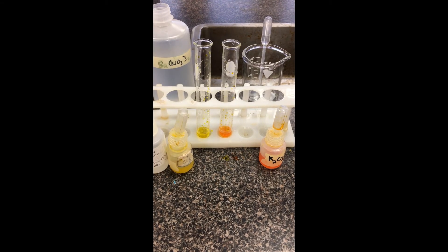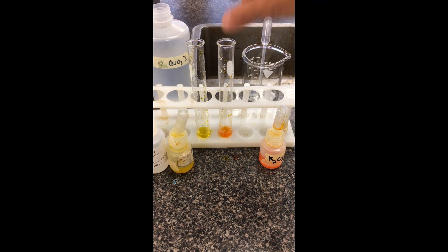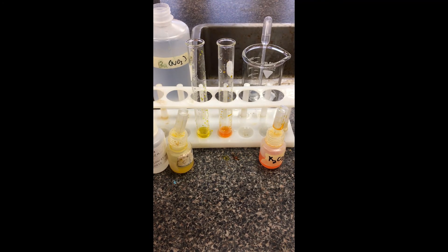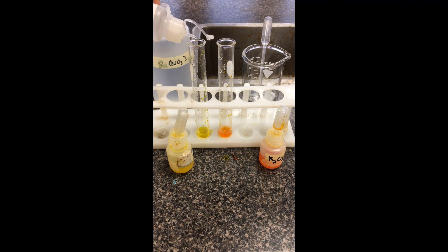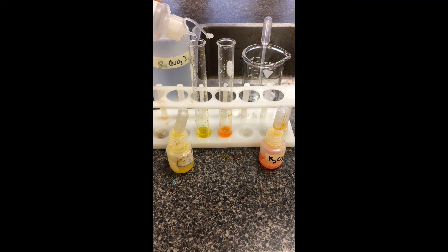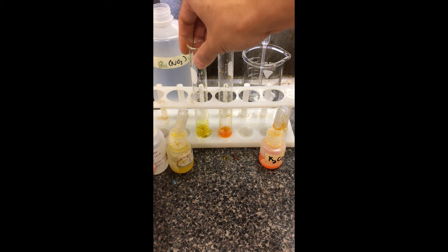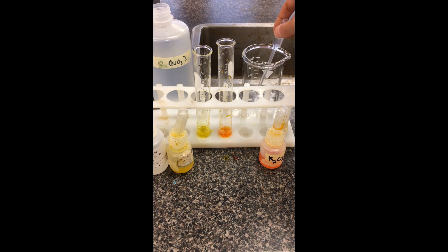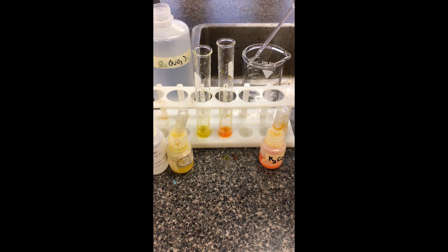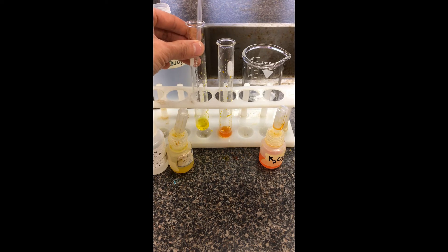We've reset again. We have our chromate solution that's yellow and our dichromate that's orange. We're going to start off focusing on the chromate solution. The lab handout says to drop in two drops of base to start off. Mix it up a little bit. Then we're going to add barium nitrate — I have it in the dropper here — and just add it in and note any changes.